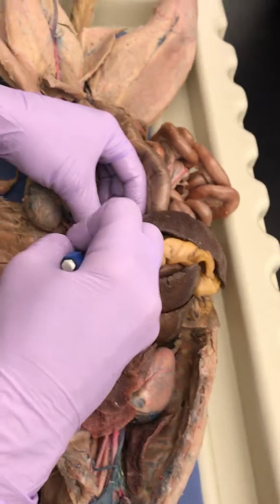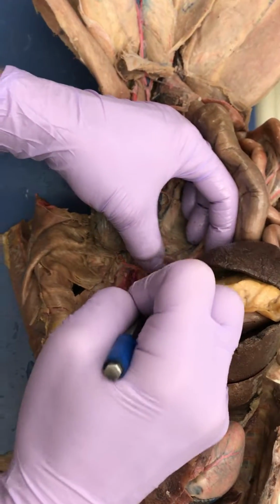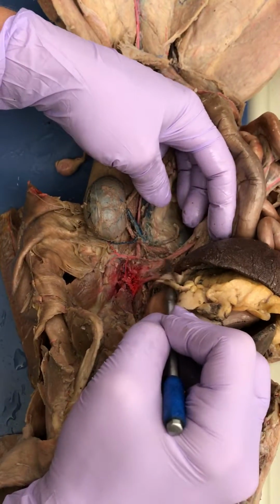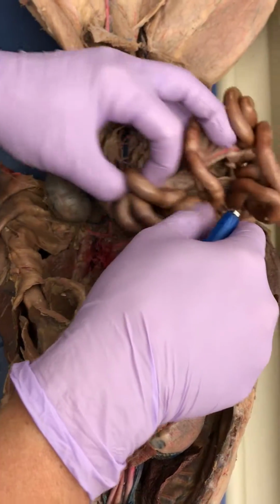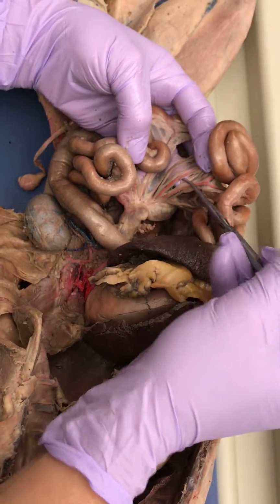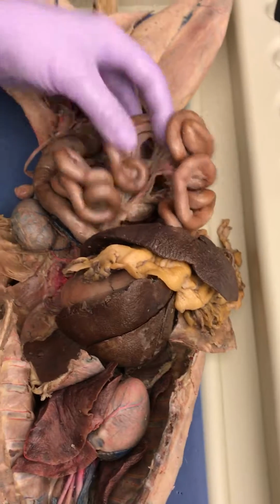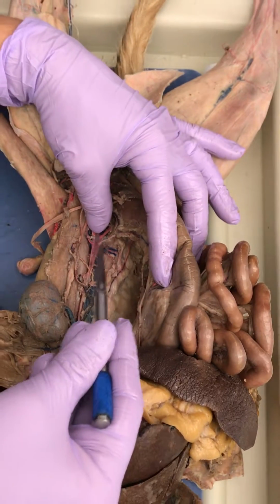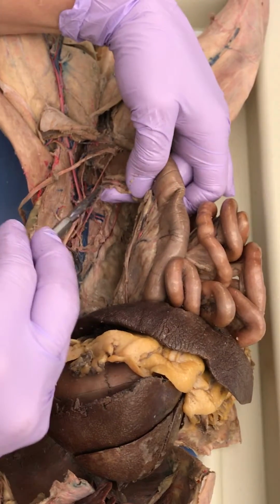Ladies, we actually could do a little more cleanup here because you found everything, so now you know that you can kind of break some of this connective tissue. See, look how much better that looks. What is that big artery right there? Superior mesenteric. Okay, then the superior mesenteric branches to make all of these. Those are the intestinals. What do you call this clear stuff? Mesentery. That's good. Okay, got another artery right here. That's inferior mesenteric. That's very good. Inferior mesenteric.